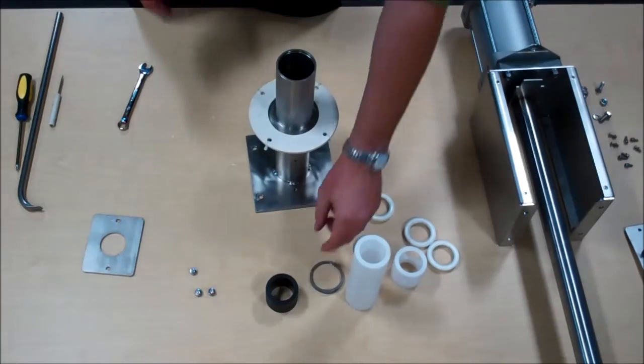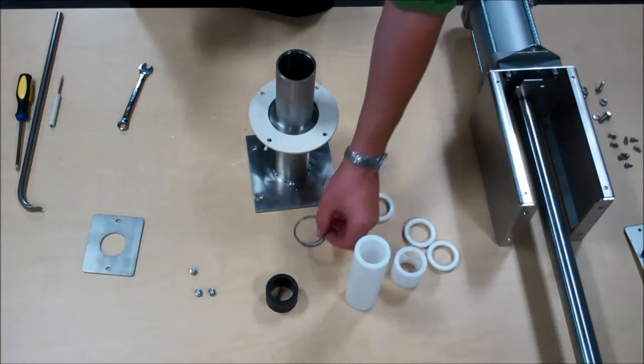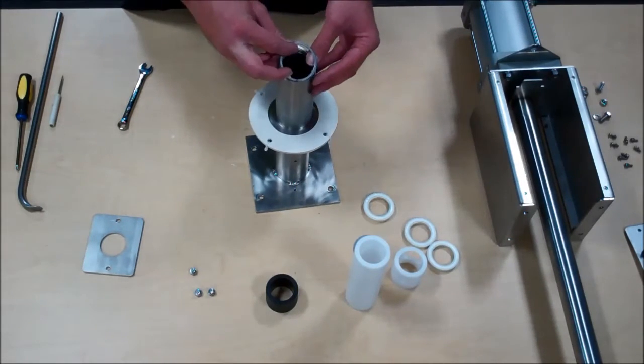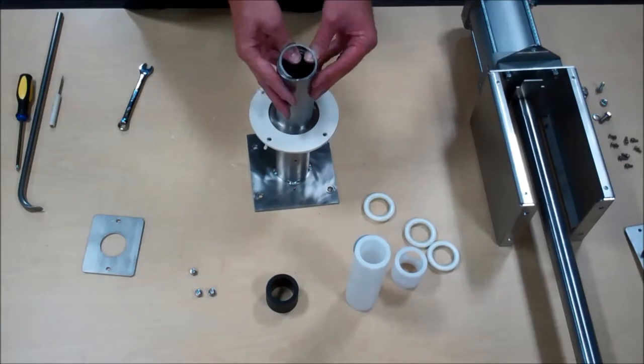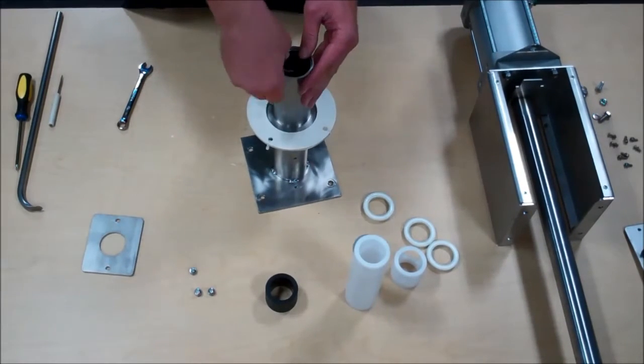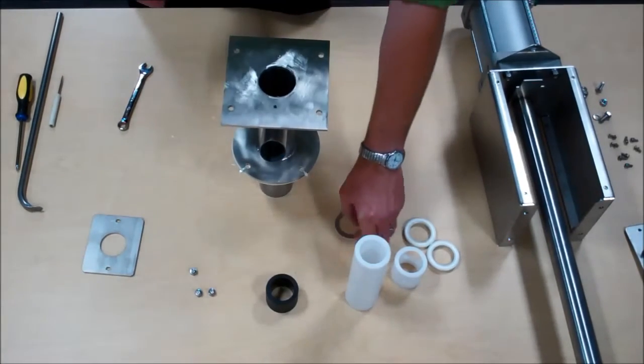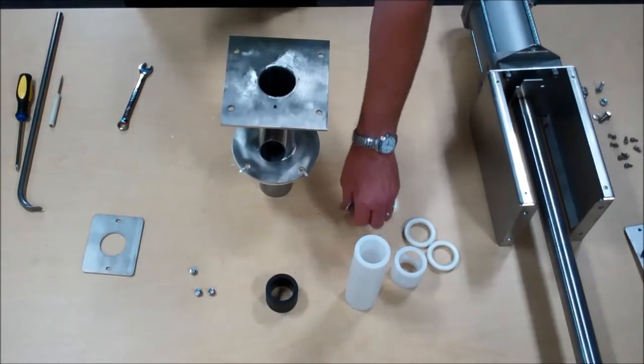Reassembly is done via reinstalling the snap ring. Next in goes the backup ring.